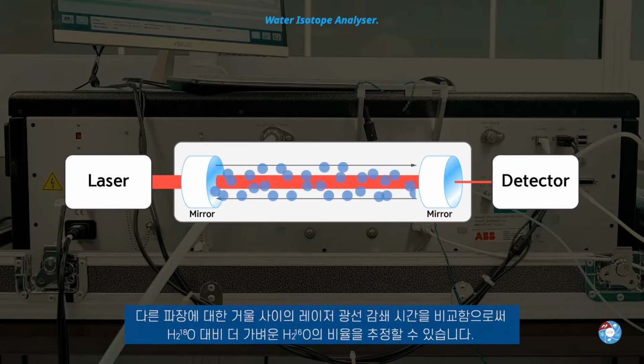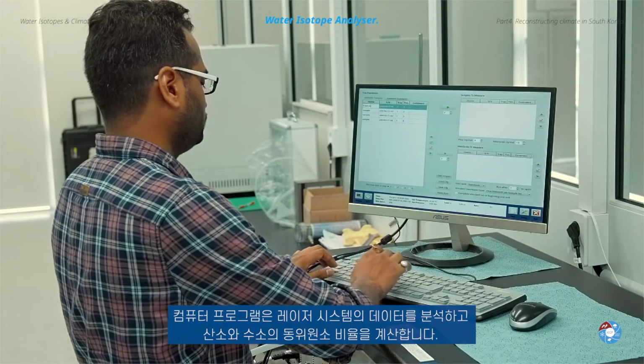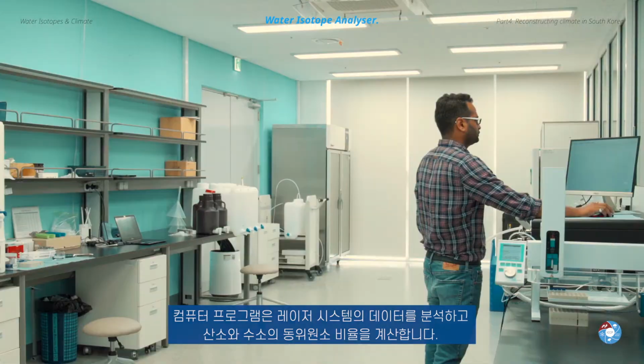By comparing the decay time of the laser light between the mirrors for different wavelengths, we can then estimate the ratio of lighter H2 16O over H2 18O. A computer program then analyzes the data from the laser system and calculates our desired isotope ratio of oxygen and hydrogen.